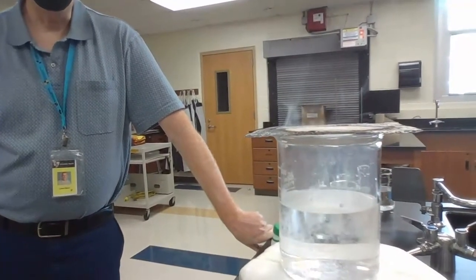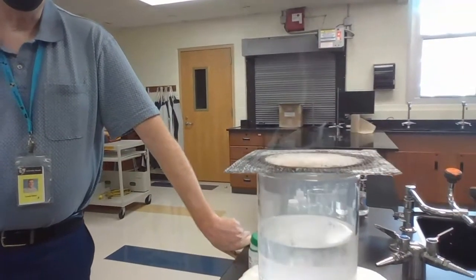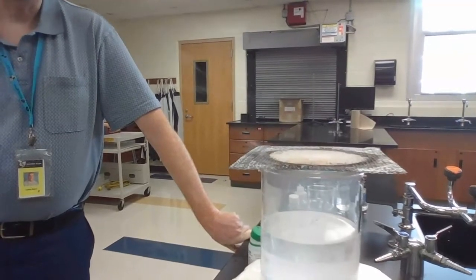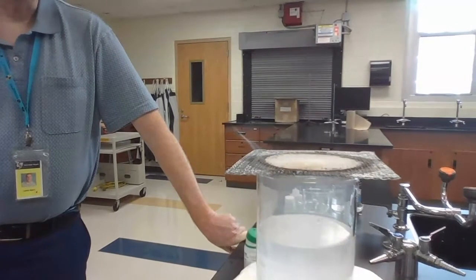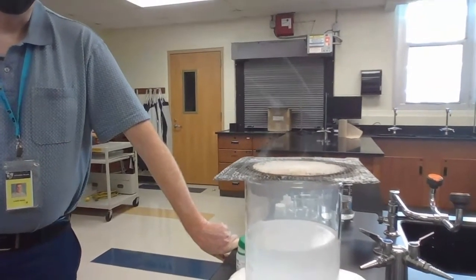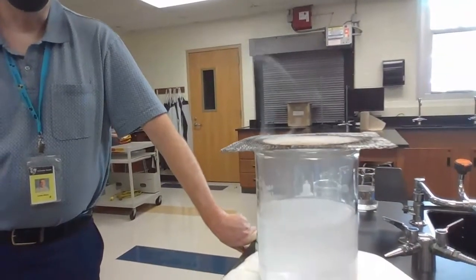Notice they're actually moving much faster than the last one. The last one kind of bumped around, and we are getting gas just like we had last time. Fizzing, bubbles. Yep, fizzing and bubbles just like before. Oh, but that one piece definitely dissolved pretty fast. We just have that last one that's kind of zooming around in there.